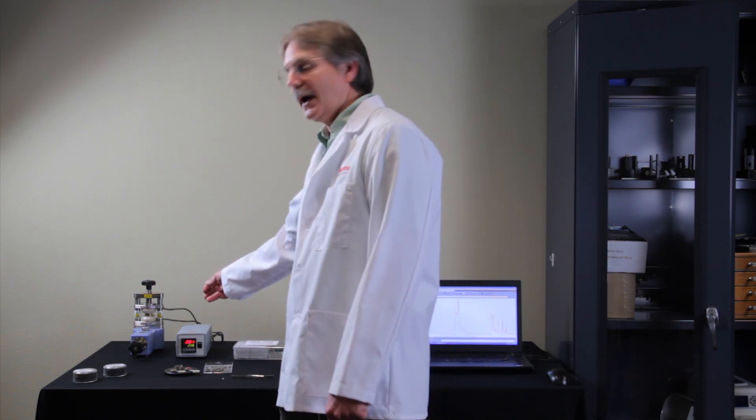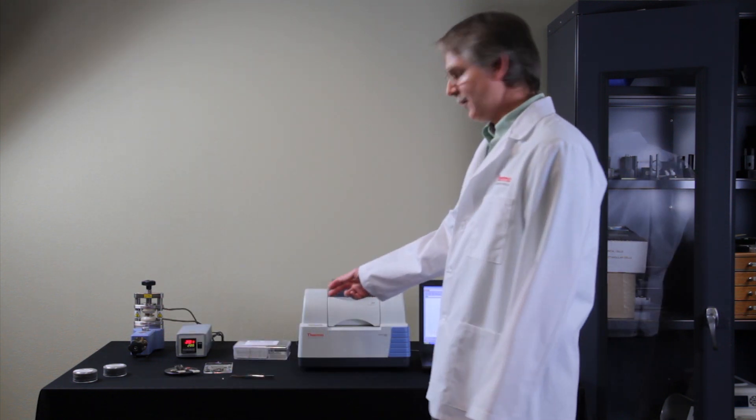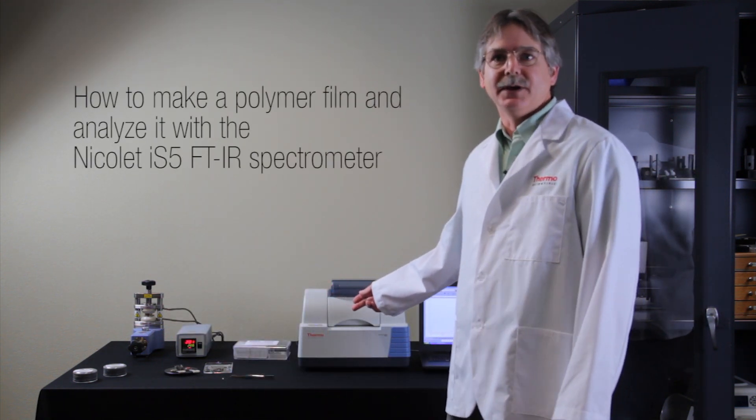Hello, my name is Todd Strother and I'm a scientist at Thermo Fisher Scientific in Madison, Wisconsin. Today I would like to demonstrate to you the SPECAC Mini Filmmaker and the Thermo Scientific Nicolet IS-5 Spectrometer.